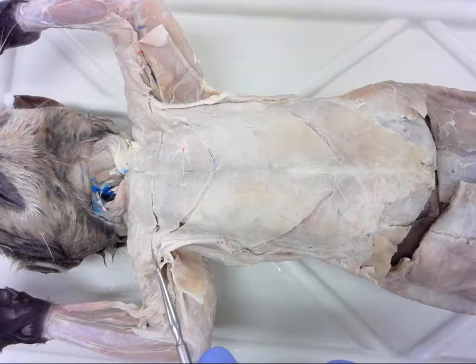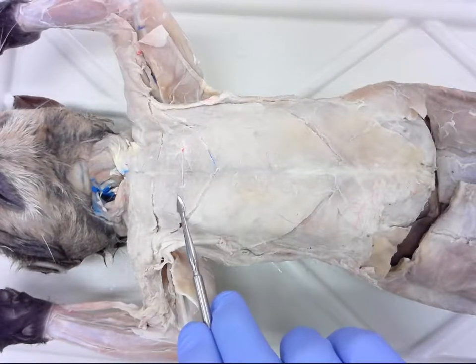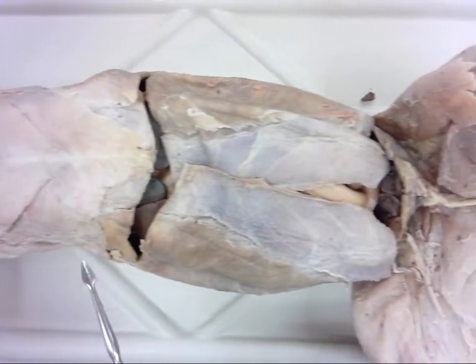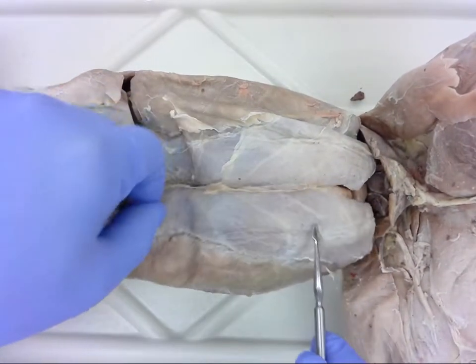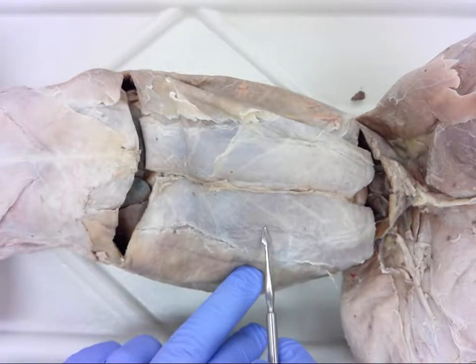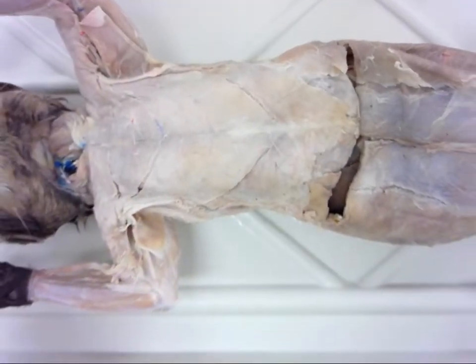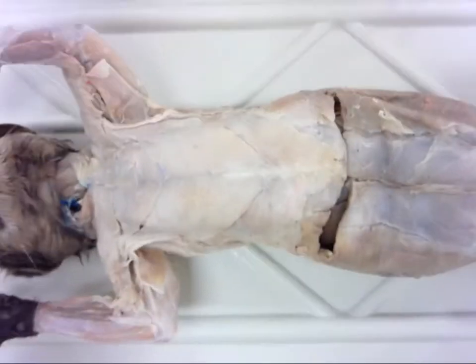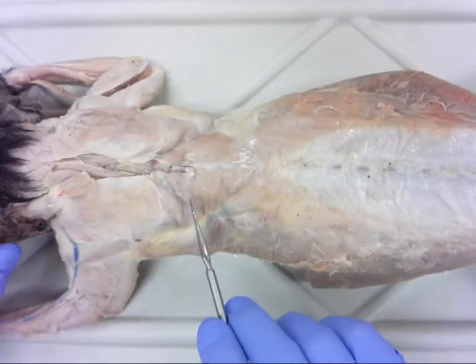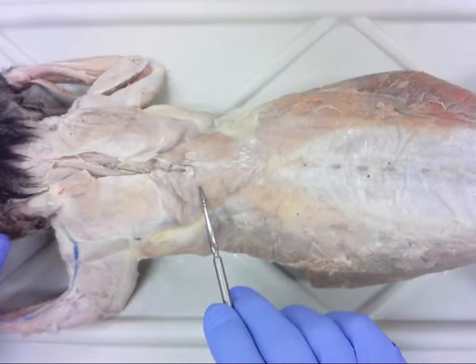Let's look at question number one — this muscle here. We'll now move down to the abdominal area. Number two is here. Number three — we'll zoom out and roll over. Number three is this muscle; you can see the outer border of number three.